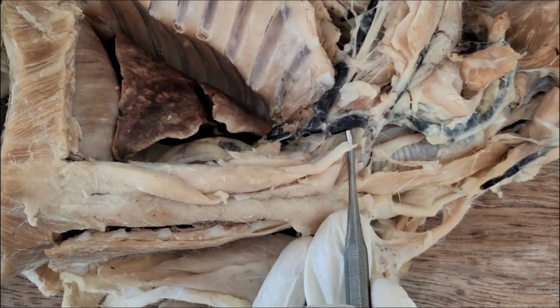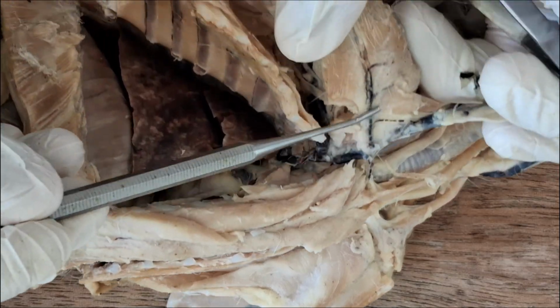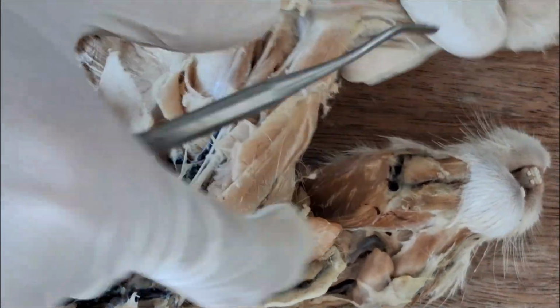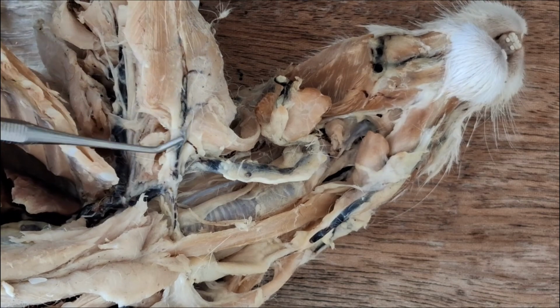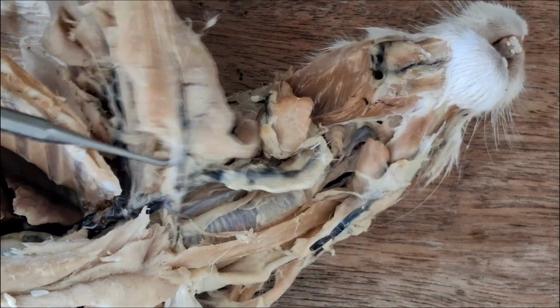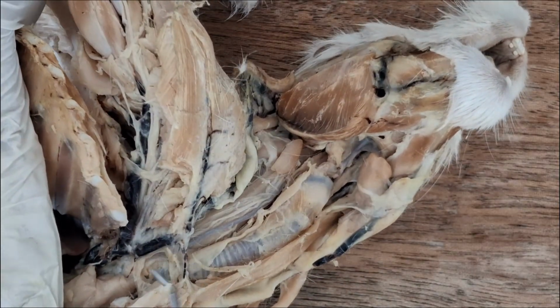Let's follow the external jugular. So the external jugular vein has a tributary here going for the shoulders. So you see, this is the limb. This would be the upper arm. So that tributary of the jugular from the shoulders is the transverse scapular vein. Transverse scapular.